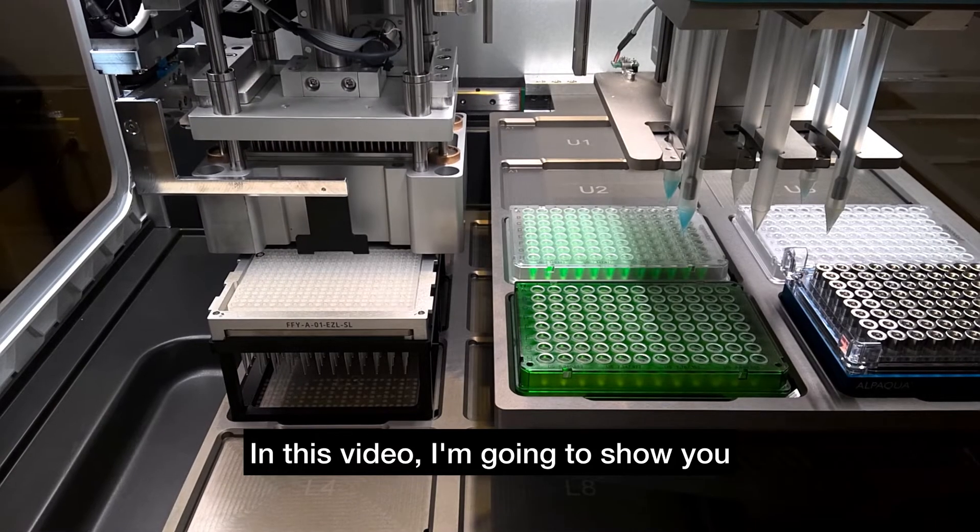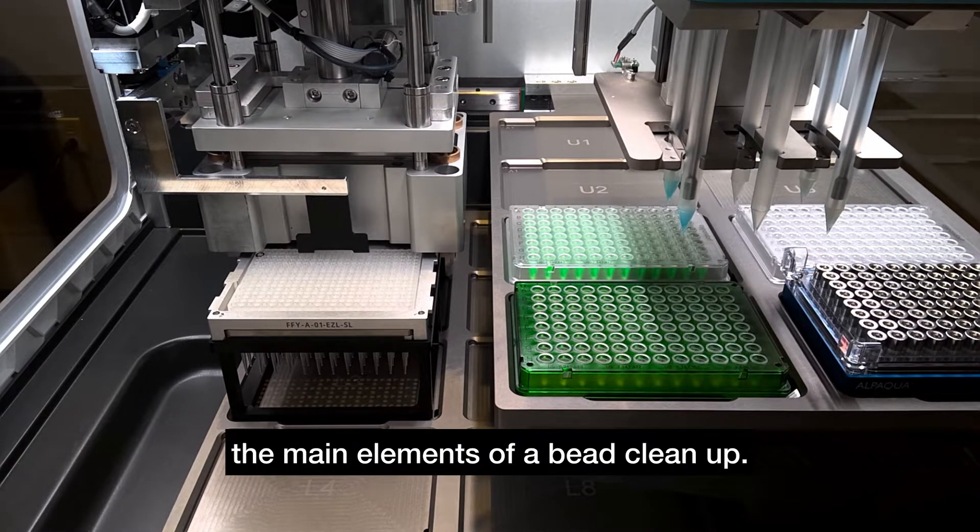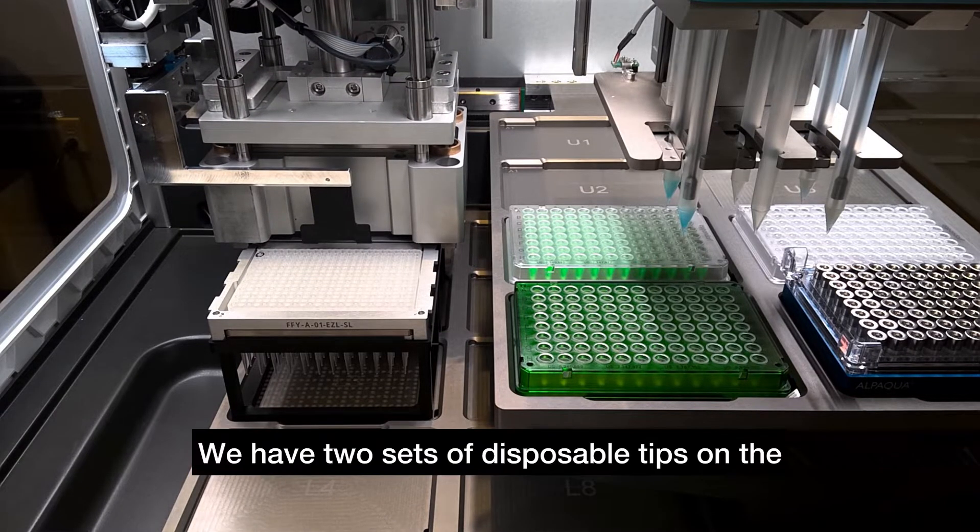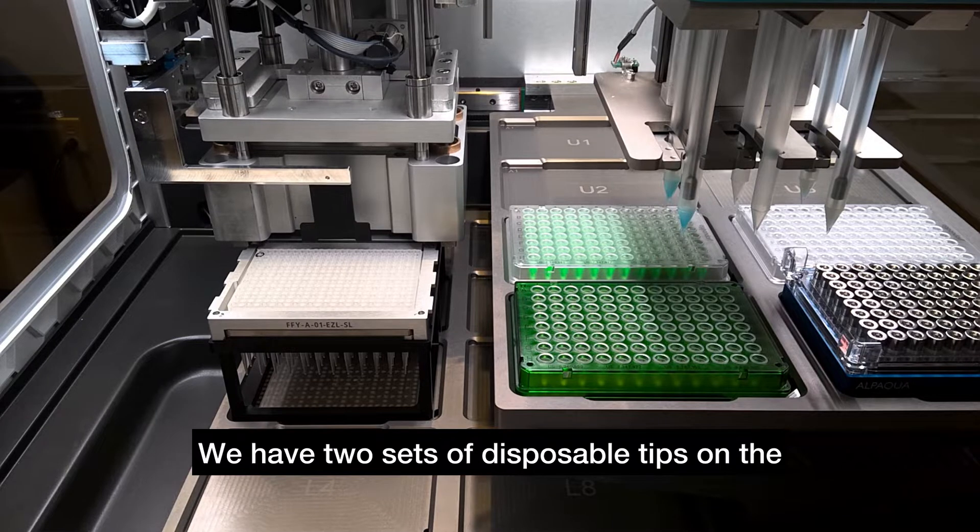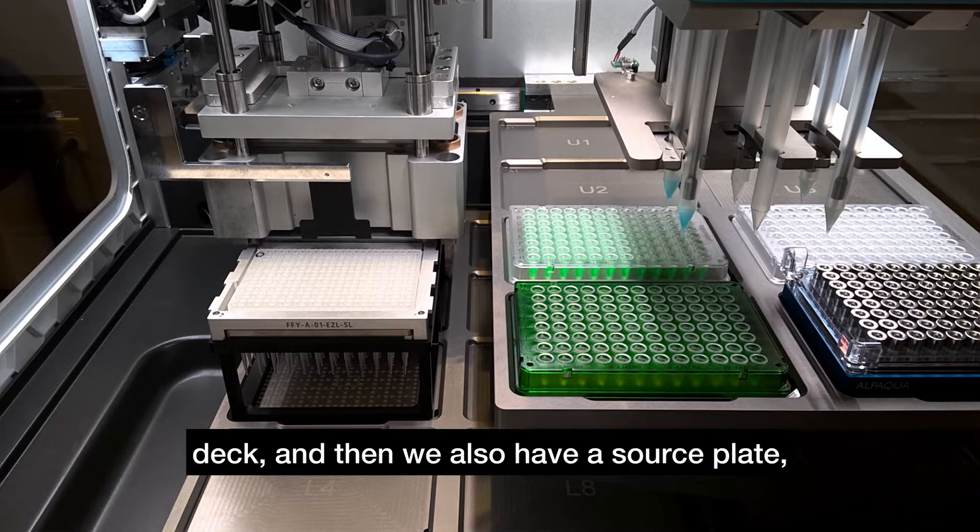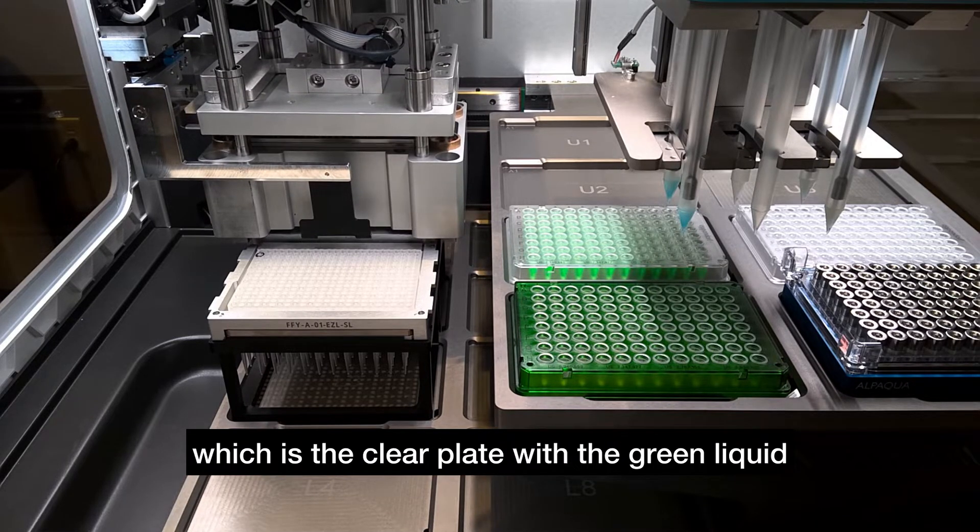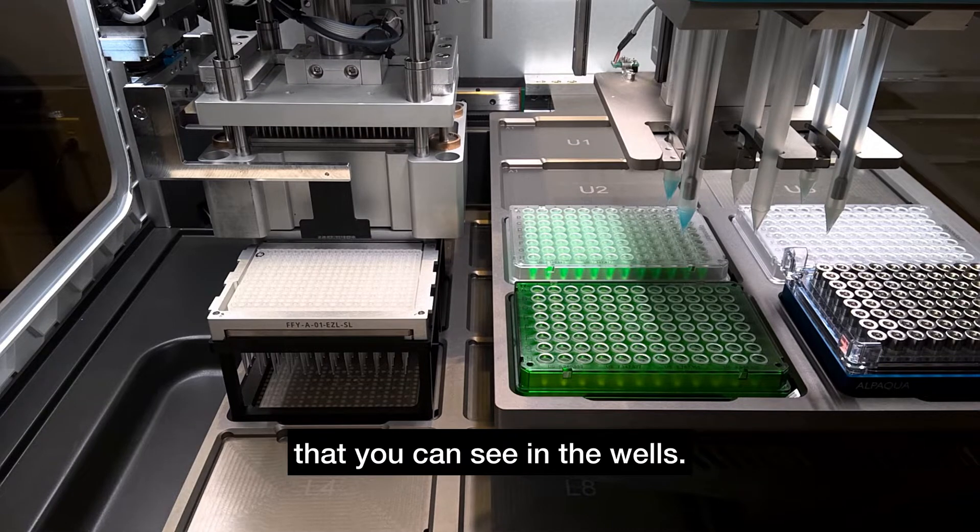In this video, I'm going to show you the main elements of a bead cleanup. We have two sets of disposable tips on the deck, and then we also have a source plate, which is the clear plate with the green liquid that you can see in the wells.